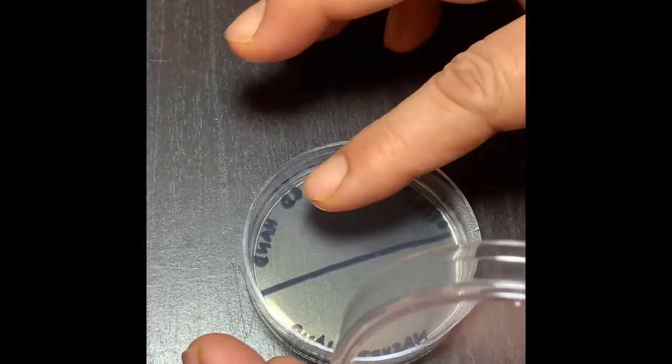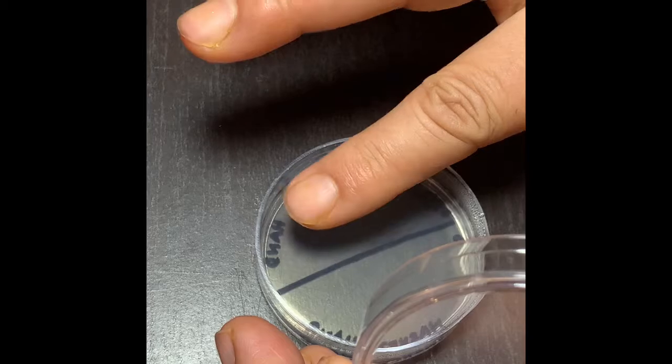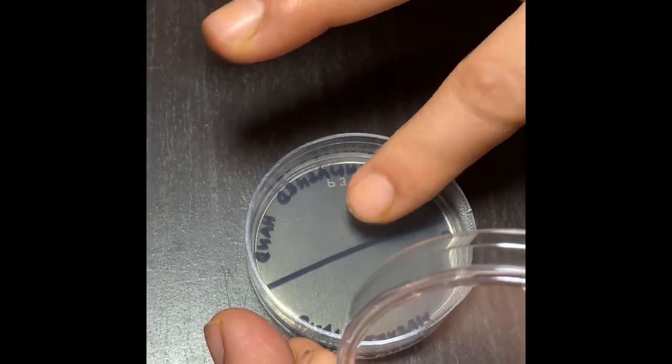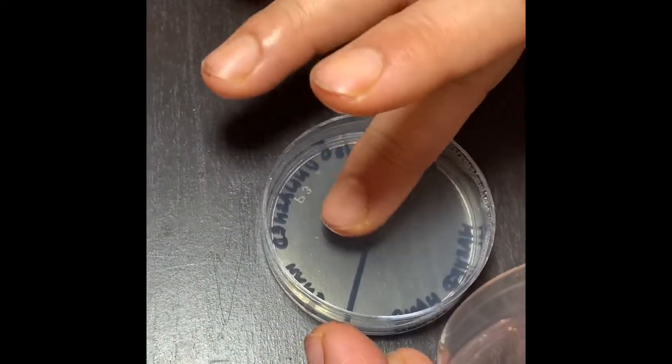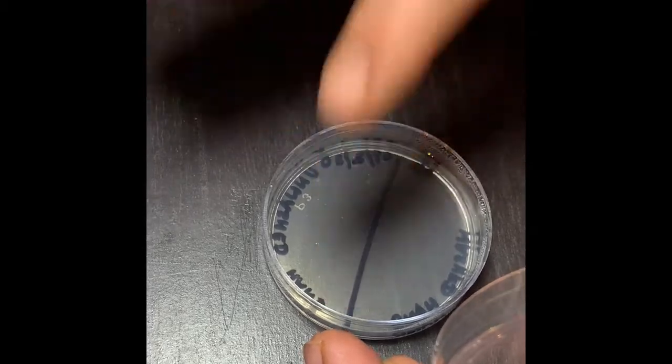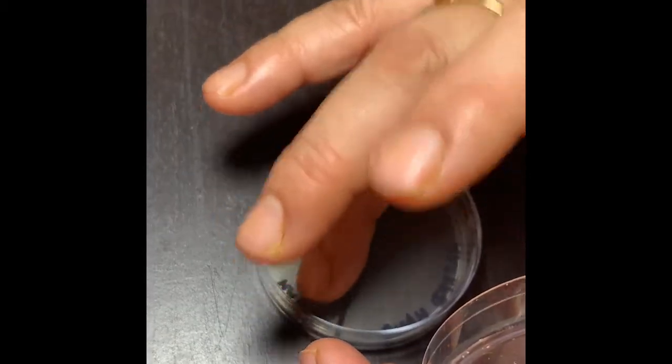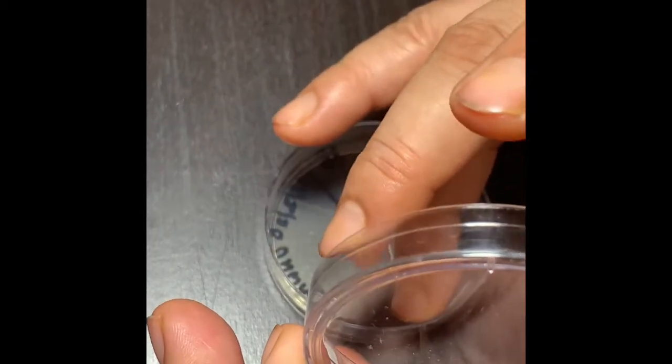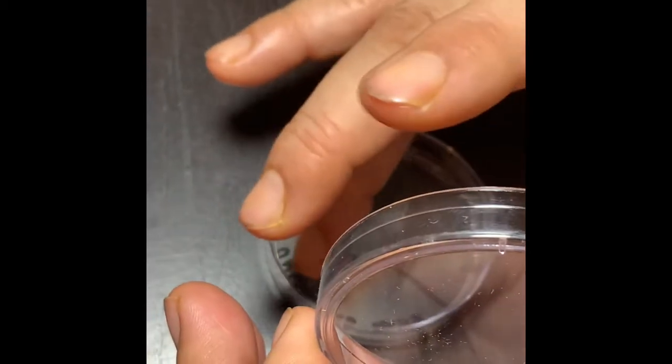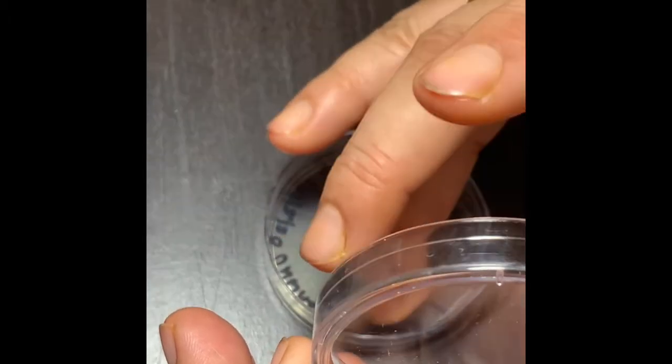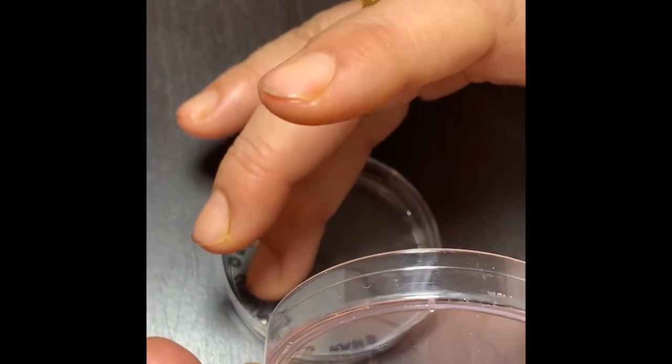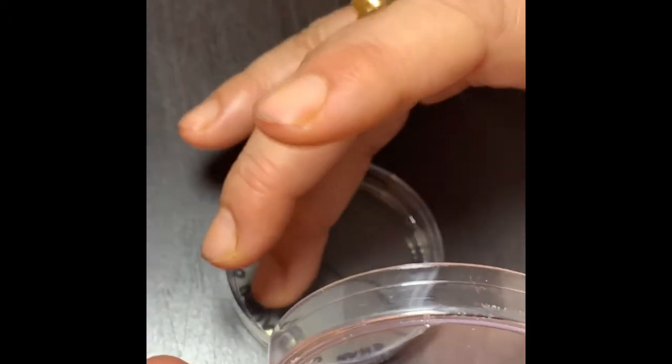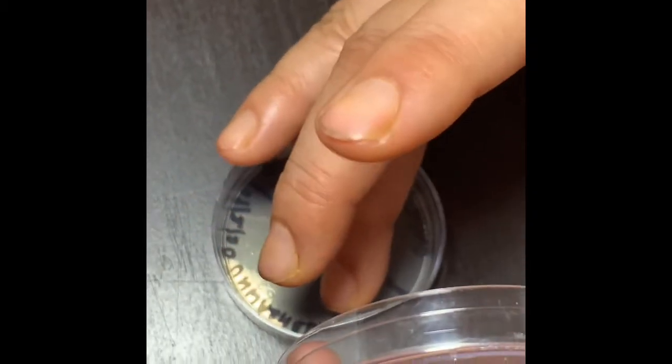Don't make any mistakes. I'm touching as much as I can on this small agar plate with all my fingers. You'll see how all fingers have germs, similar to what is shown in a pediatrician's dispensary or a doctor's office.